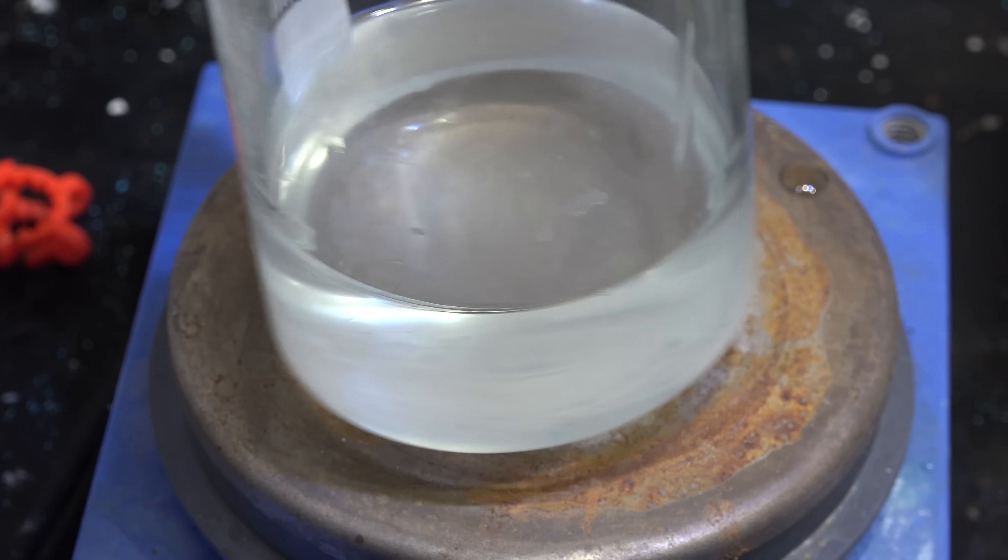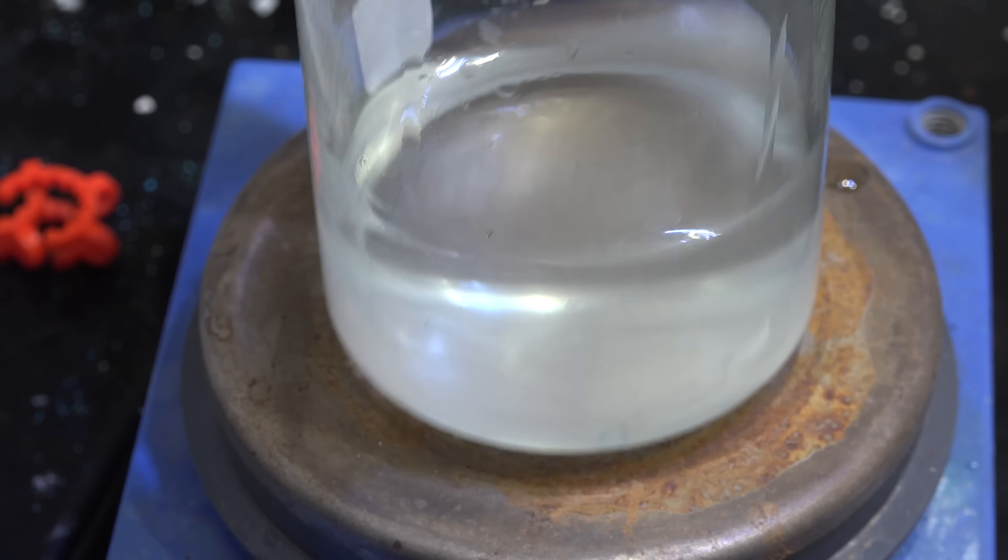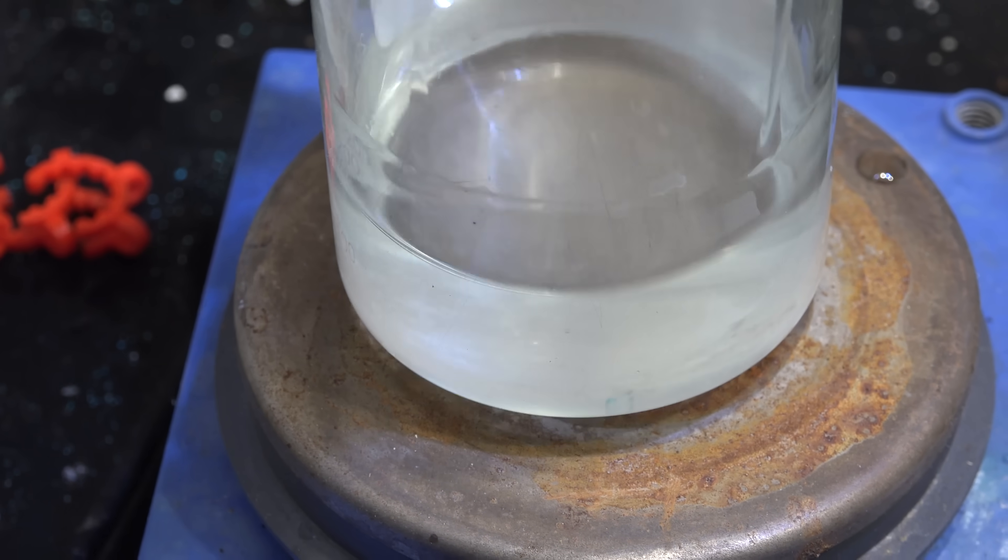In this video we're going to make sodium silicate. By itself it's not all that interesting, but it's a useful precursor to many silicon-based compounds.